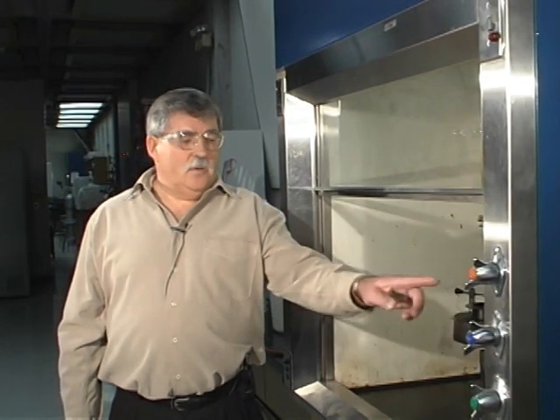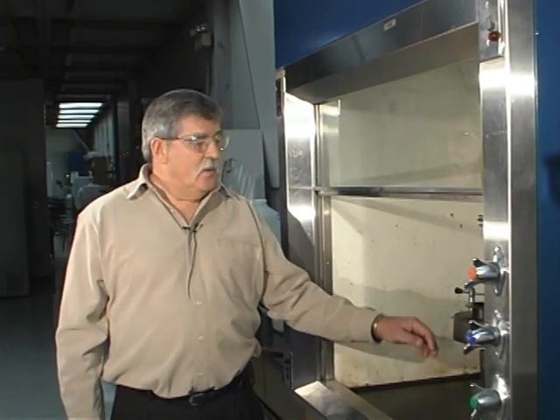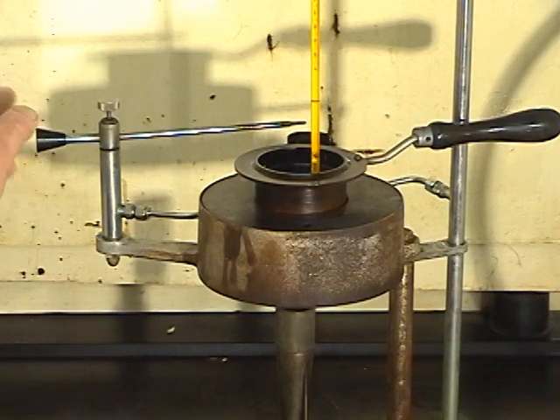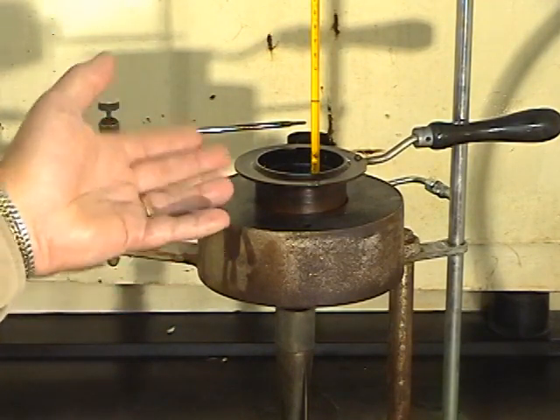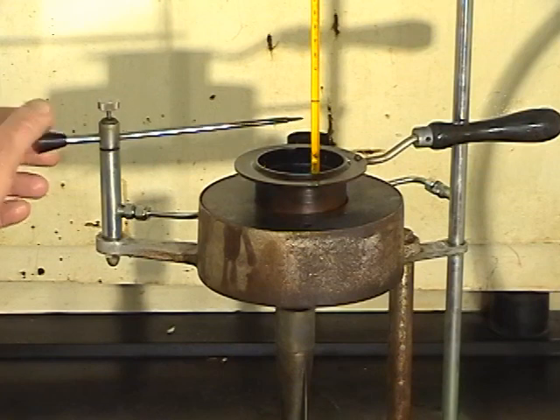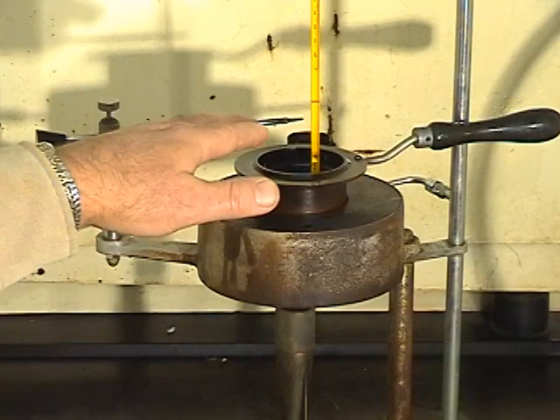Micah is going to turn on the gas and we're going to light the Bunsen burner, then light a flame at this point — that should ignite the wand. As you've learned in your studies, as we heat this oil it should generate vapor which will be flammable in air, and we will slowly and steadily move this flame back and forth.